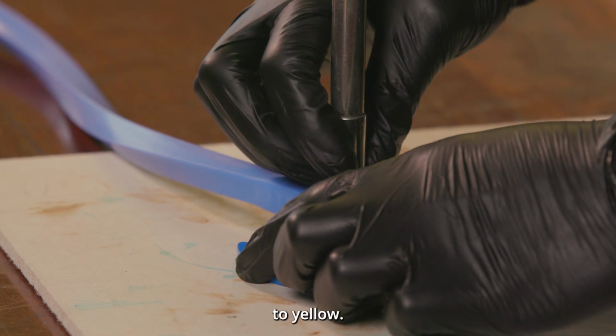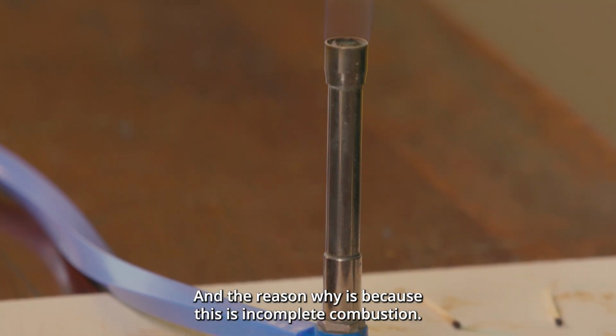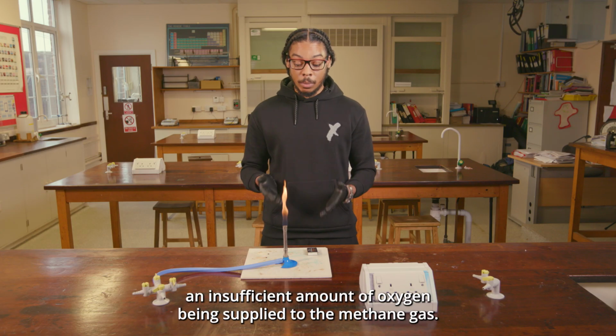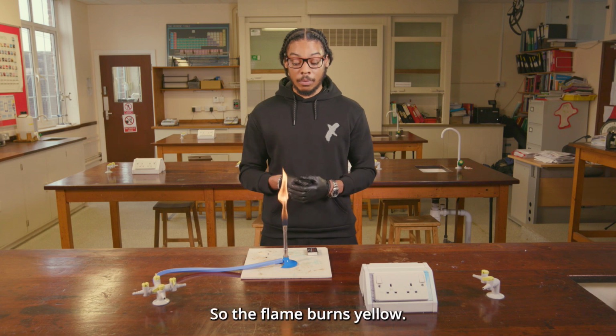Right, so when I close the collar of the Bunsen burner, we can see that the flame turns from blue to yellow, and the reason why is because this is incomplete combustion. This means that there is an insufficient amount of oxygen being supplied to the methane gas, so the flame burns yellow.